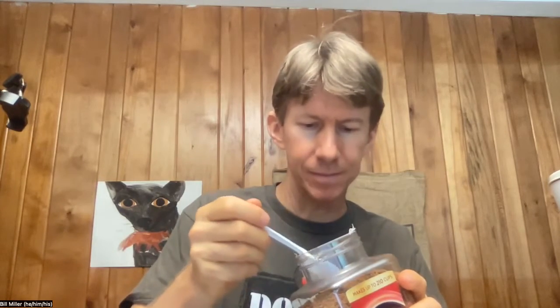I'm going to put 2.5 grams in there, so 11.3, 12.3, 13.3, 13.8. The exact amount doesn't matter — we're shooting for approximately 2.5 grams. I got 14.3 grams, so a little bit more. That's fine.